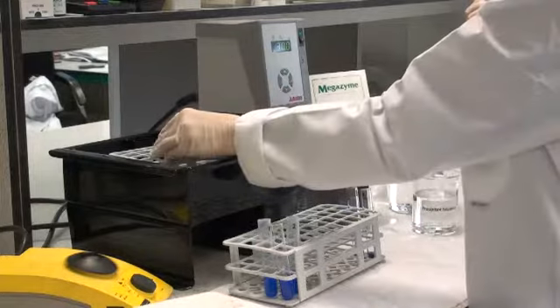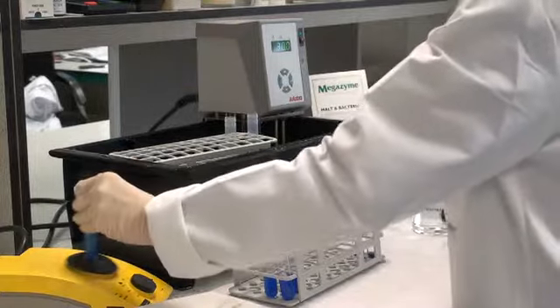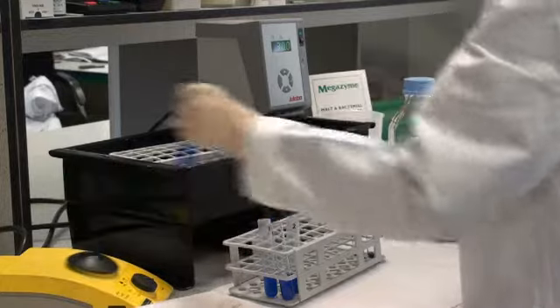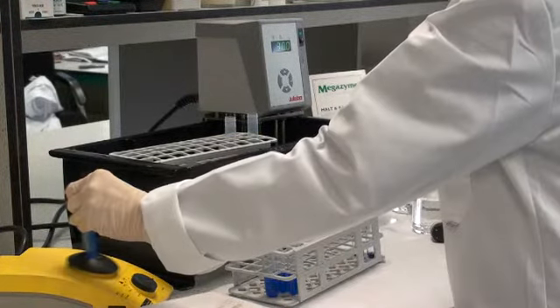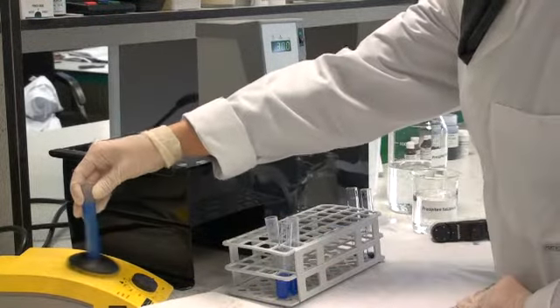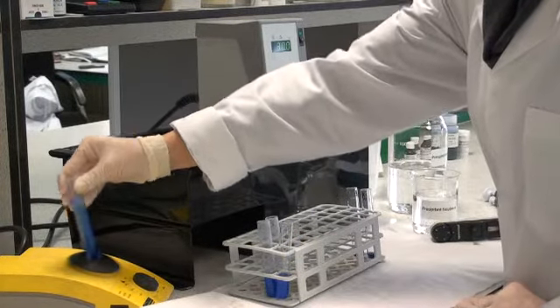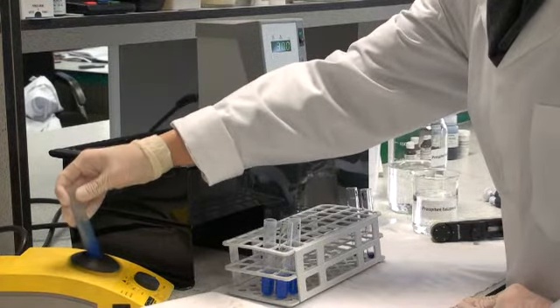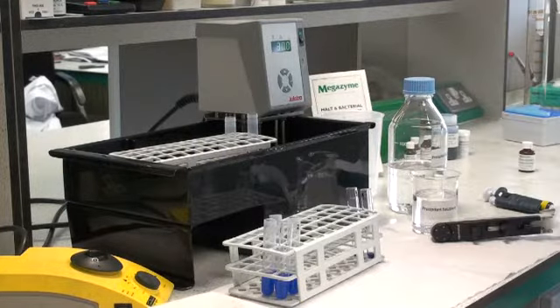It's absolutely critical that these tubes are stirred very well, because this is a precipitation reaction. If the solutions aren't mixed thoroughly, this reaction won't occur properly. When all the reactions have been stopped and the tubes stirred, repeat the whole process. These tubes will then be left at room temperature for approximately 5 to 10 minutes before they're centrifuged and the color is read.